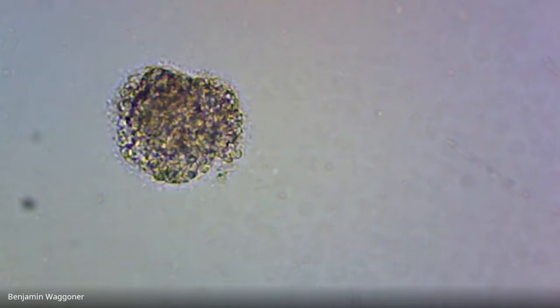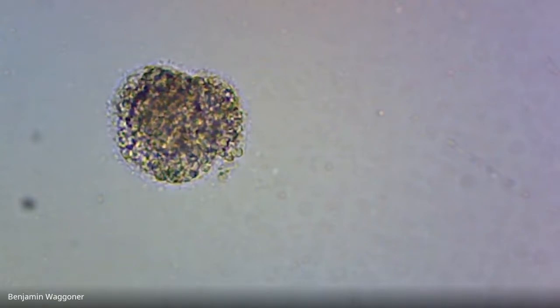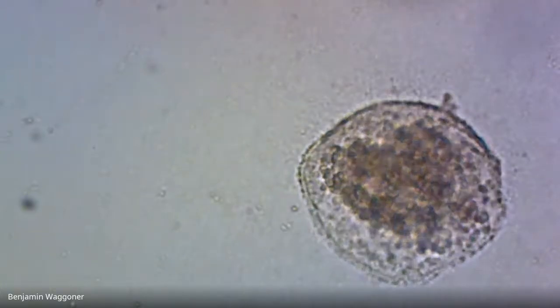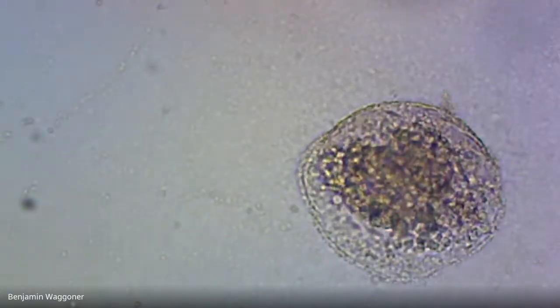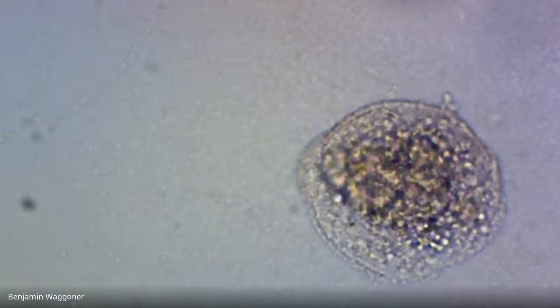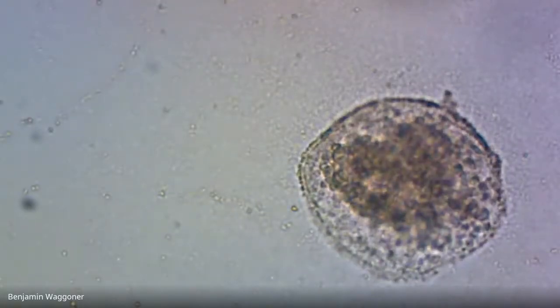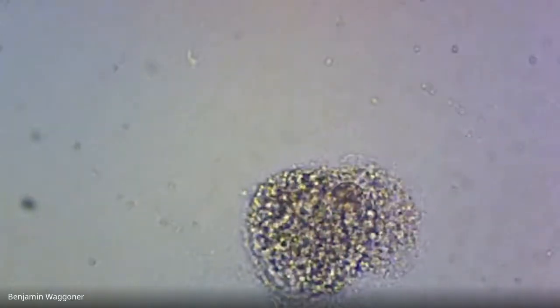There's another one that just looks wrecked. And another one that could be prism, but the insides don't have a clear gut. The insides just look messy. And another one that I think is just garbage.